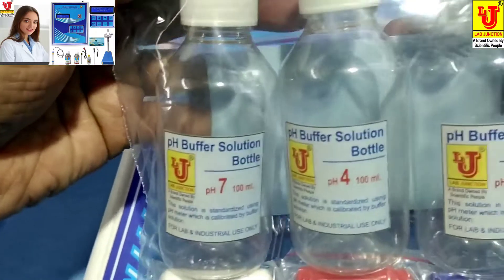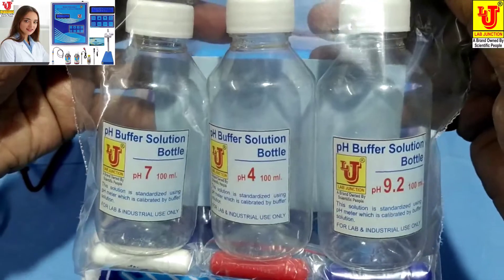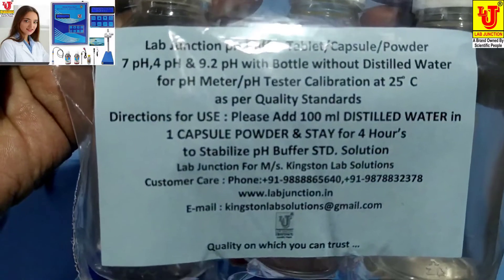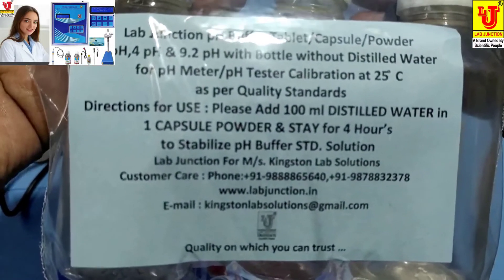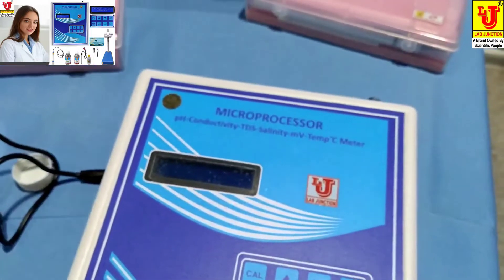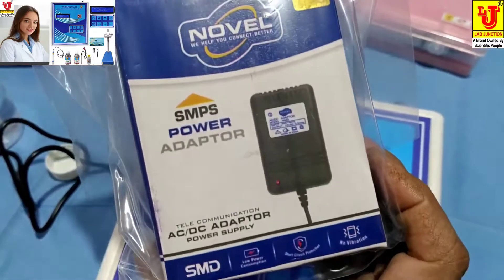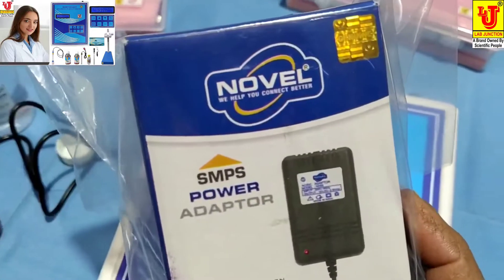Three buffer bottles: 7 pH, 4 pH, and 9.2 pH, along with an instruction procedure for making buffer solutions. Also included is a 12-volt adapter for the main power supply.